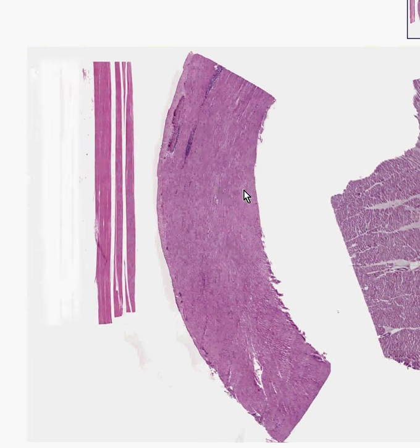Let's go to the first one on the left, and let's zoom it up a little bit. You could quickly see, I hope, that these fibers here are clearly striated. In addition, they are arranged very longitudinally, like logs on a neatly stacked fireplace. In addition, you can see that the nuclei are all out at the periphery. So this is classical voluntary skeletal striated muscle.